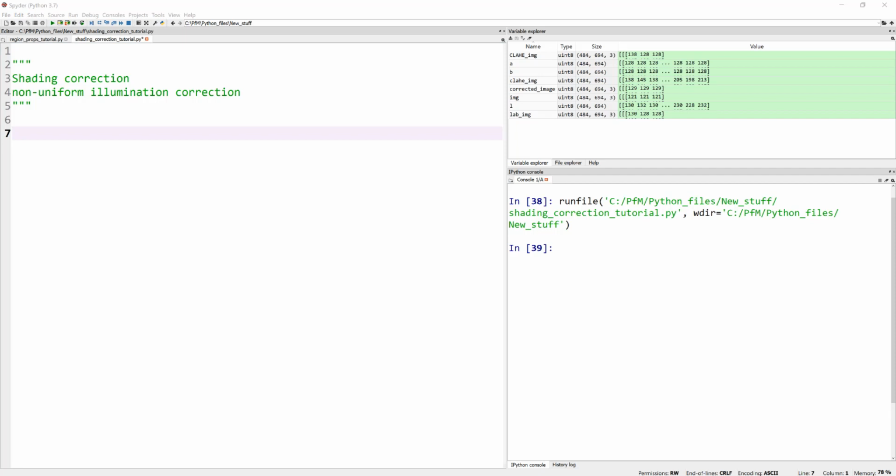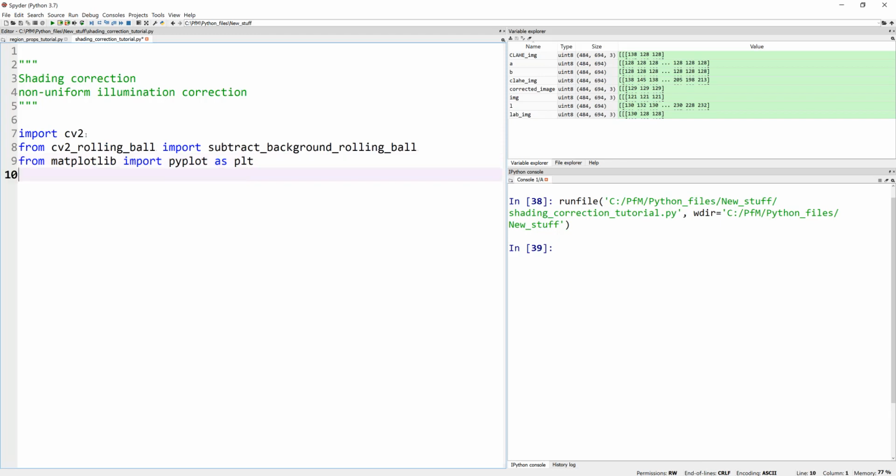Now, in the past, I have actually coded the entire rolling ball a long time ago, but someone, a good Samaritan, actually made this available as part of Python. This is available in ImageJ, by the way.